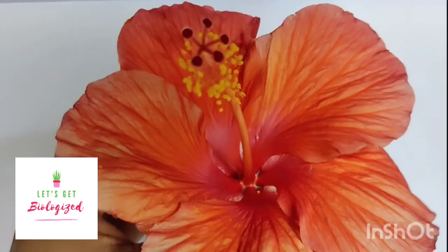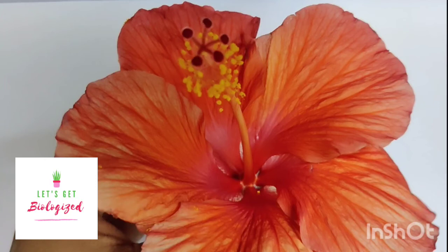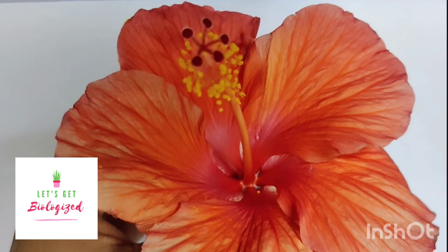There are four whorls in a flower: calyx, corolla, androecium, and gynoecium. Calyx and corolla are accessory whorls. Androecium and gynoecium are essential whorls.